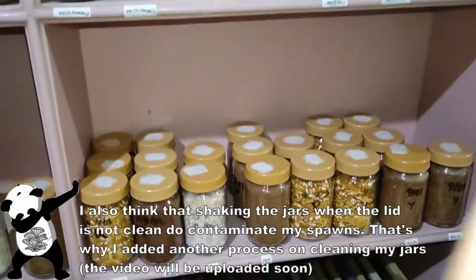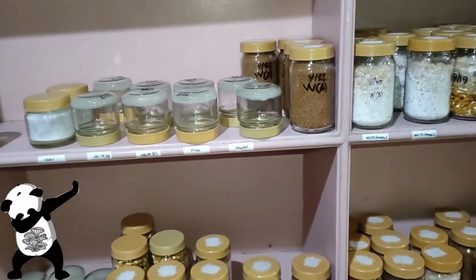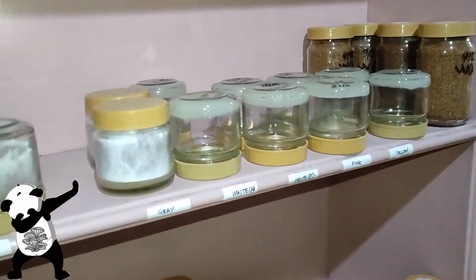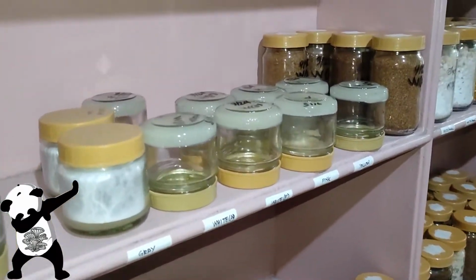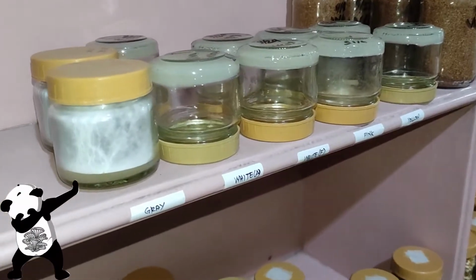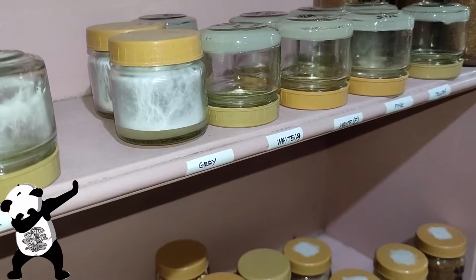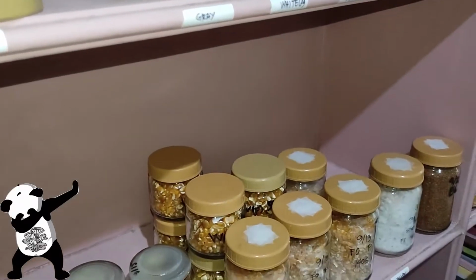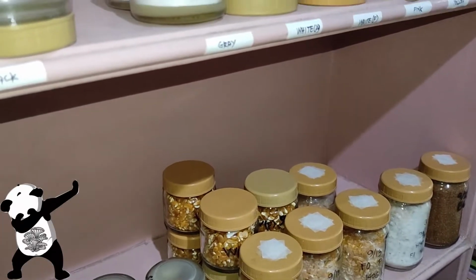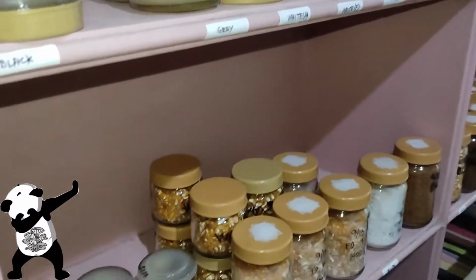You do see some of my spawns, especially sawdust spawns, which I've been doing recently, because one of the good things about sawdust spawns is that it is cheap, and at the same time it has fewer issues regarding contamination. But I'm still going to test that out on the fruiting bags that I have inoculated with sawdust spawns.